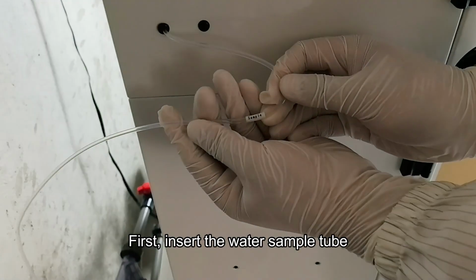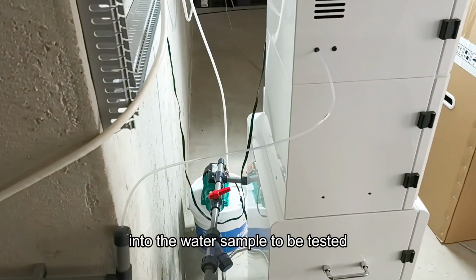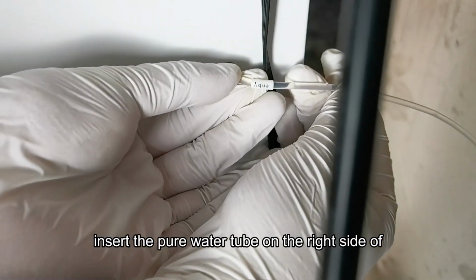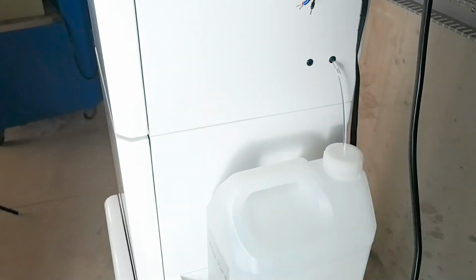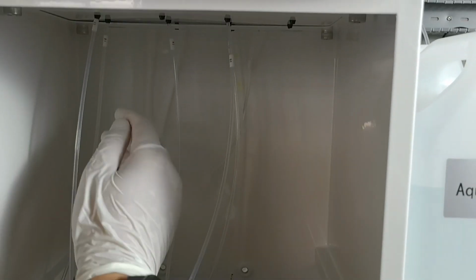First, insert the water sample tube on the left side of the analyzer into the water sample to be tested. Insert the pure water tube on the right side of the analyzer into the pure water. Next, open the analyzer cabinet door.